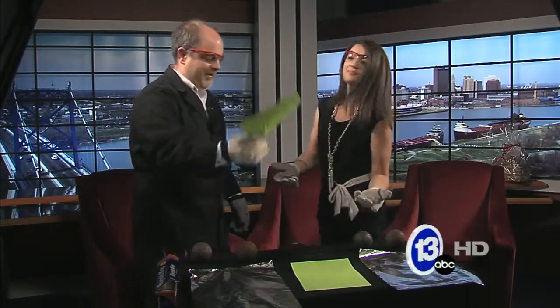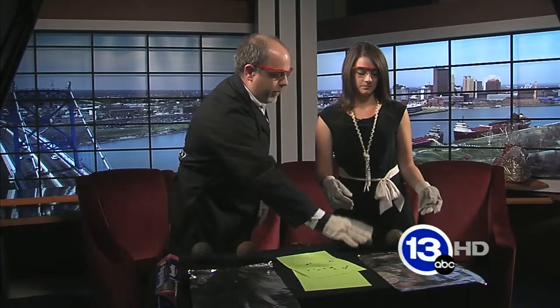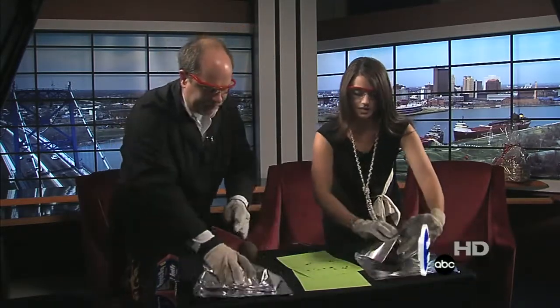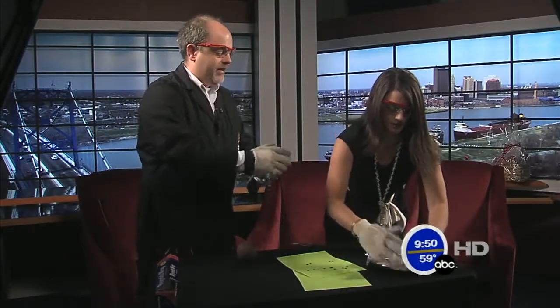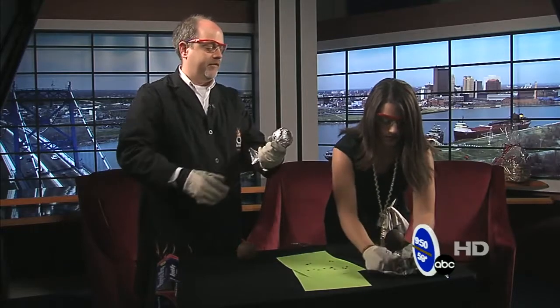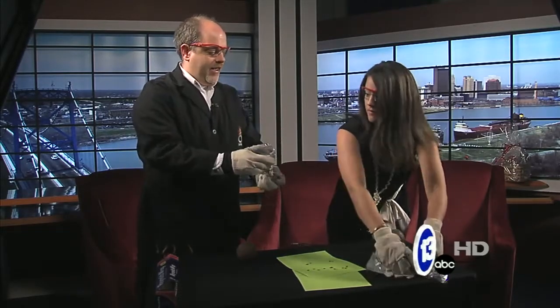Of course we're going to amp it up. So we're going to take some aluminum foil. Go ahead and wrap this sphere with the aluminum foil — I'll do the same with mine. Nice and smooth, just one layer if you can. Even make a little tail on the end so you can hold it better, kind of like this.